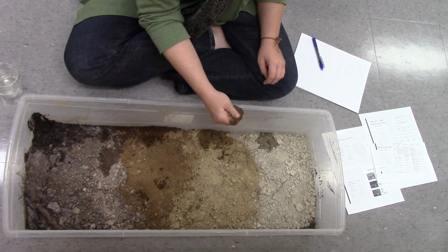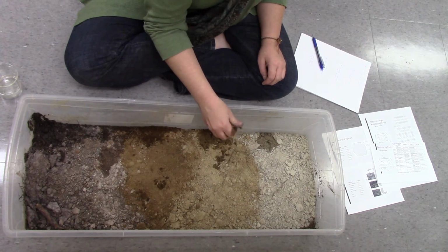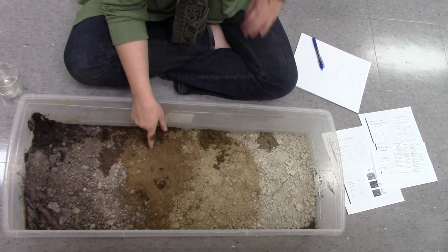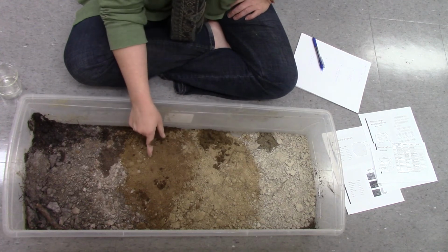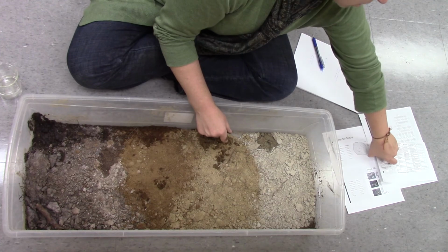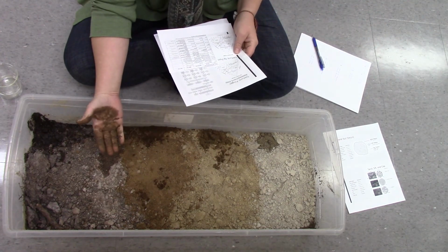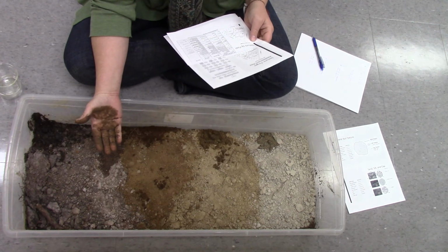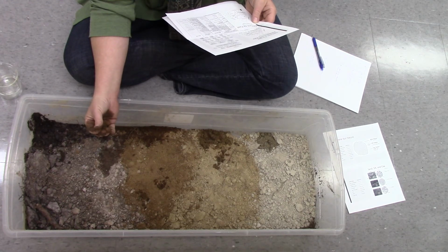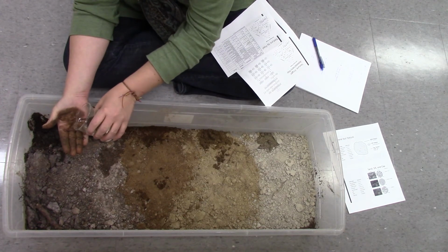And it's not making a ribbon at all. That also means that if this is loamy and this isn't, this might be a BHF layer and this might be a BF layer. Things to think about. Loamy sand, sandy loam. I think they're both loamy sand, but slightly different.